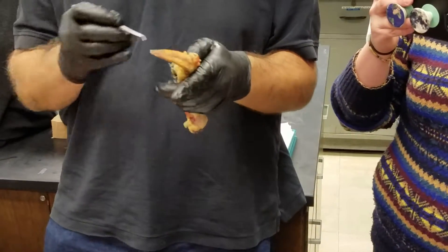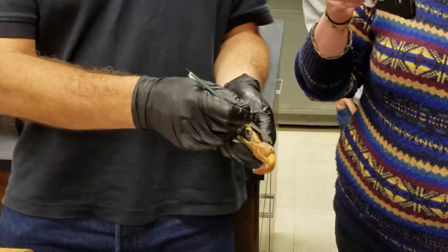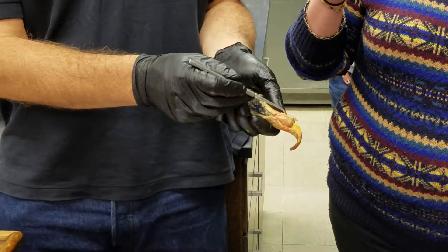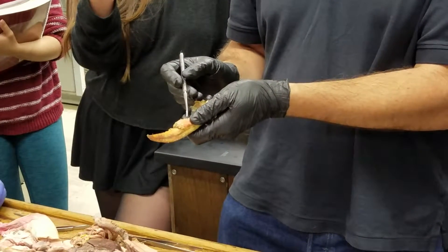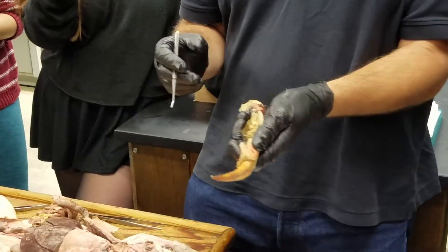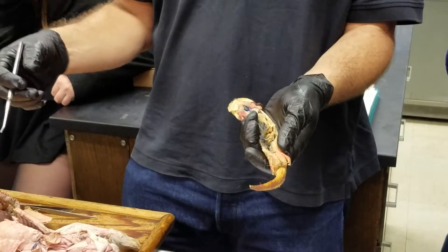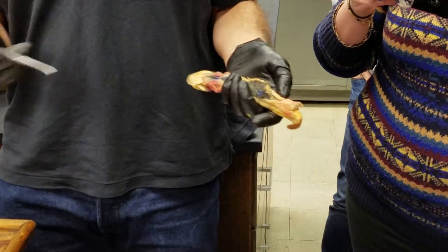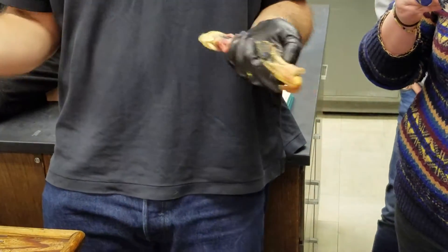This is a male, so it has this huge swollen region around the cloaca — this is the cloacal gland. Its function is to secrete spermatophores, because these animals have internal fertilization but the males don't have a penis. The male plops down a spermatophore and the female picks it up into her cloaca. If you find a salamander in breeding condition that's male, you'll always see this huge swollen cloacal region — that's how you identify a male salamander.